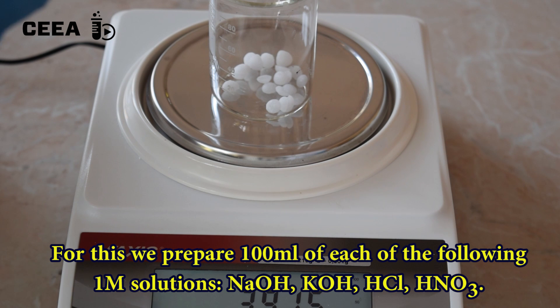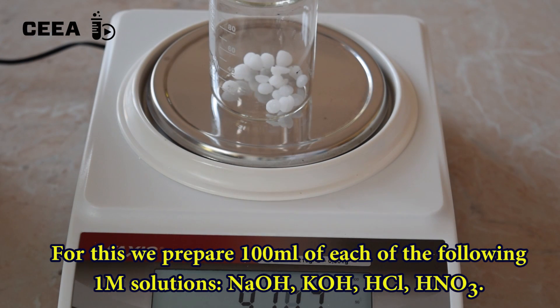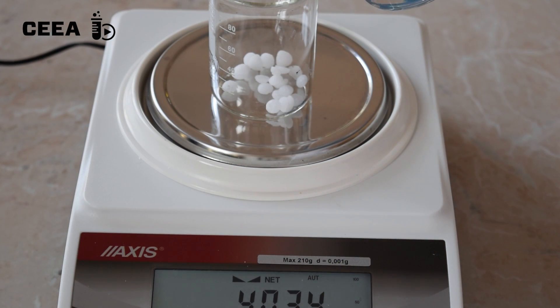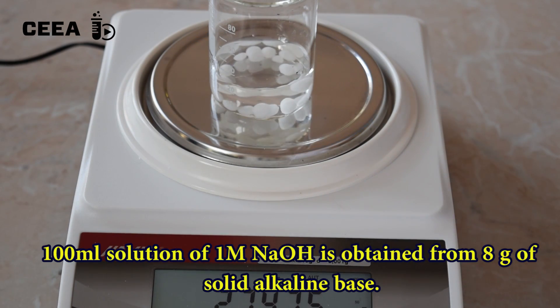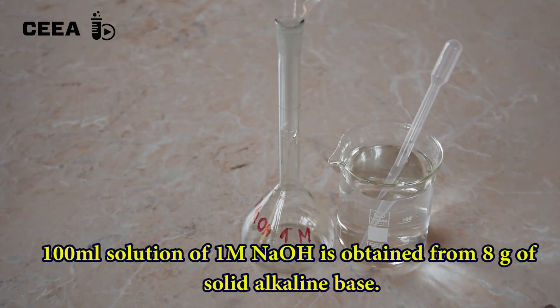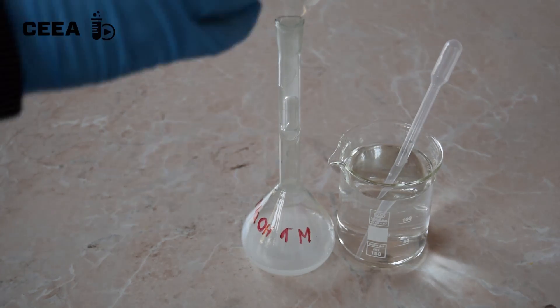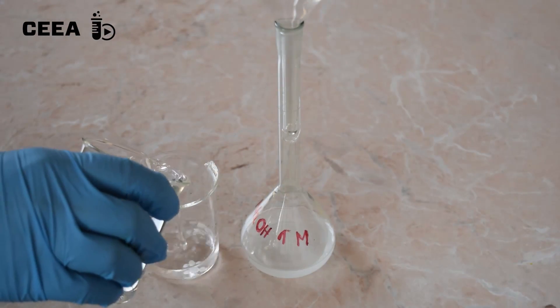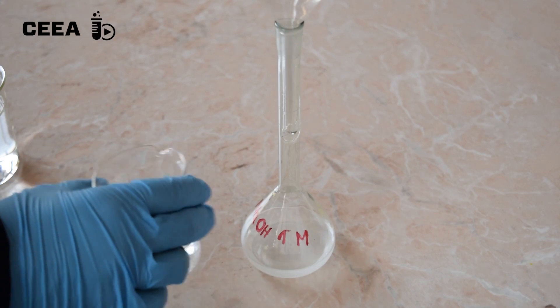1 molar solutions are needed from the following reagents: sodium hydroxide, potassium hydroxide, hydrochloric acid, and nitric acid. Follow the general guidelines to prepare 1 molar solutions of them.